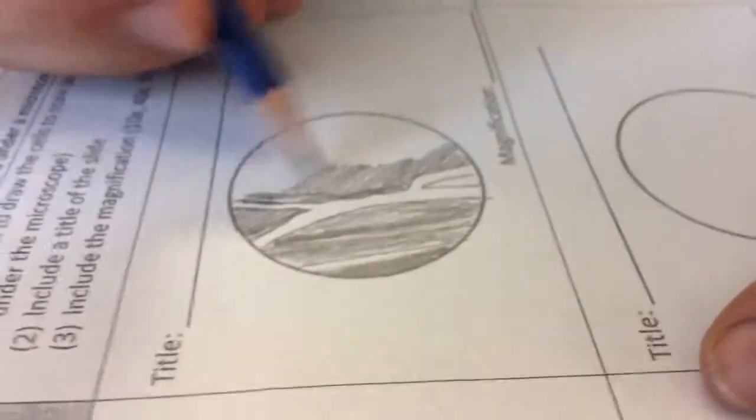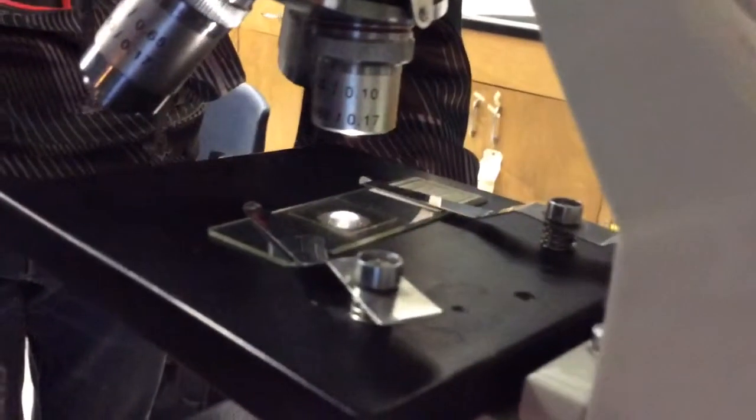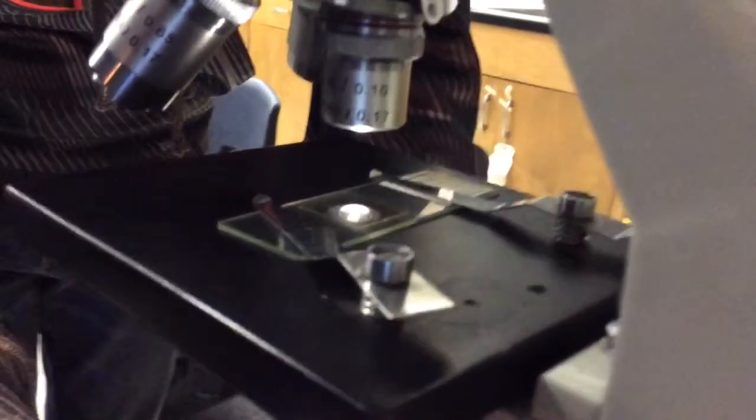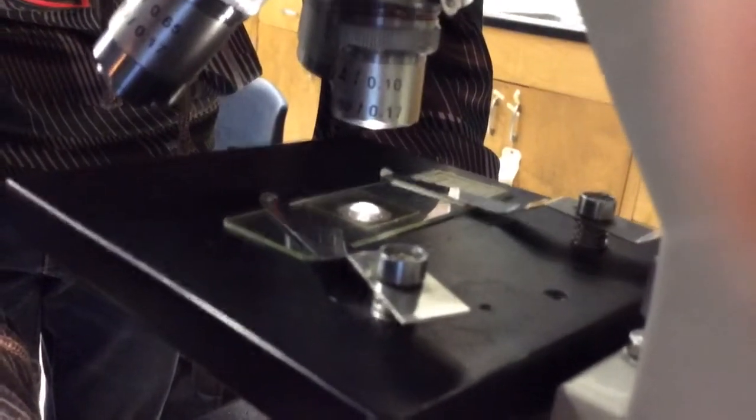That was actually, you guys are doing a great job. The low power objective there. And then, as a result, he's using the coarse adjustment knob. Beautiful.